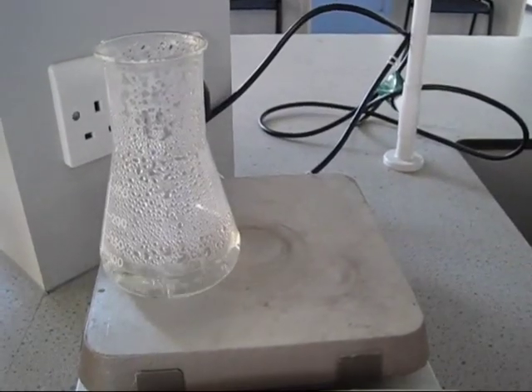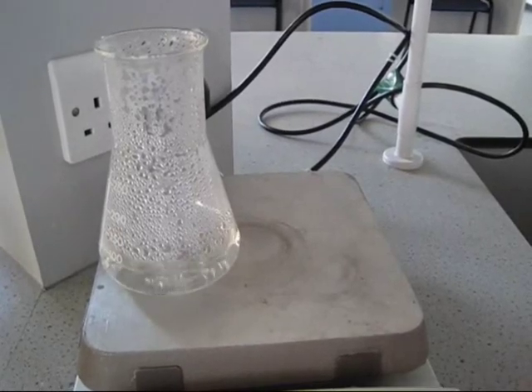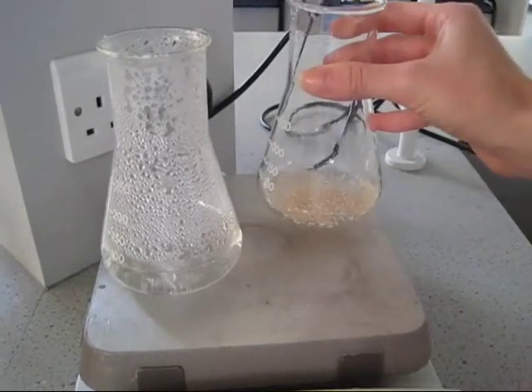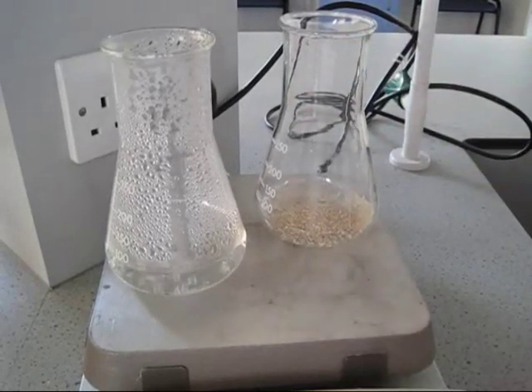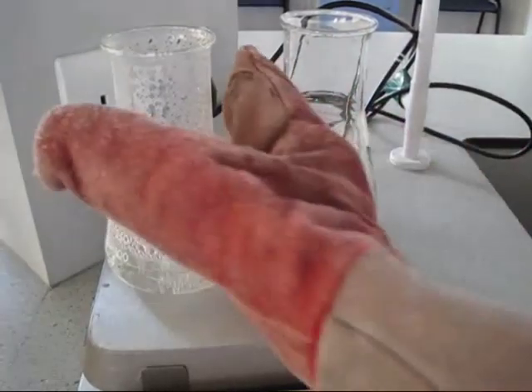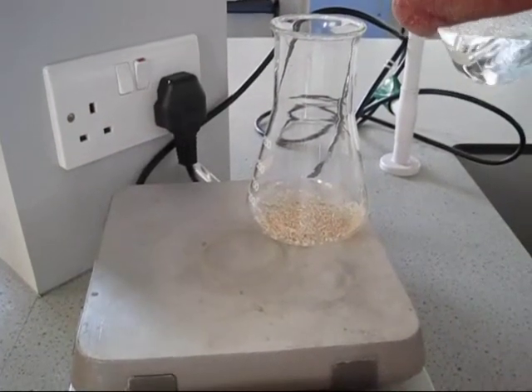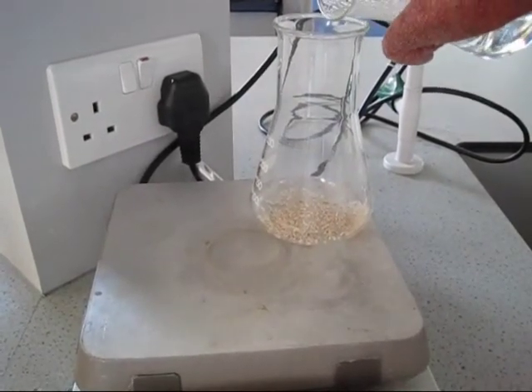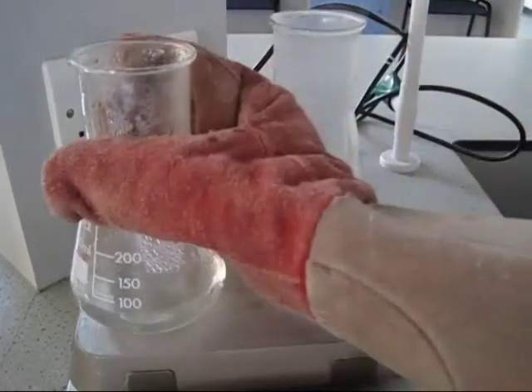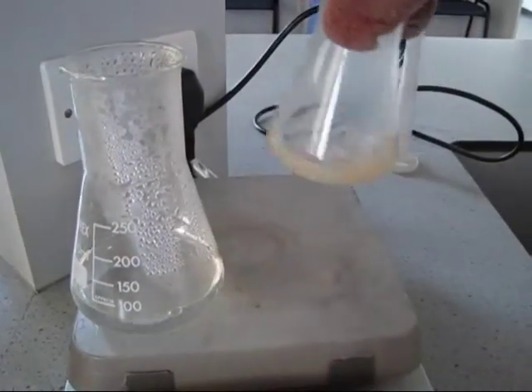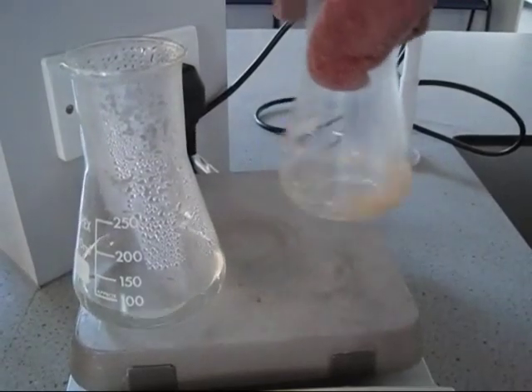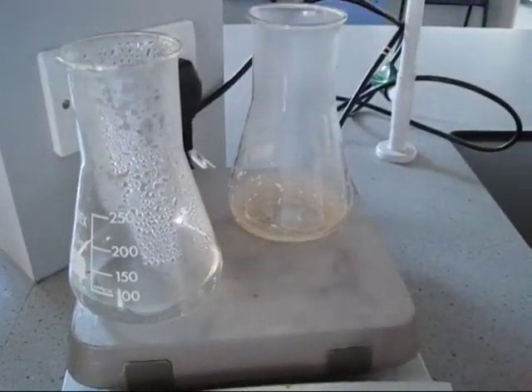Once the water is boiling, we can take our product that we want to recrystallize, pop it in a conical, place it on the hot plate and now we can begin to add our hot solvent, in this case water, the minimal amount to dissolve our product, and we add it bit by bit.